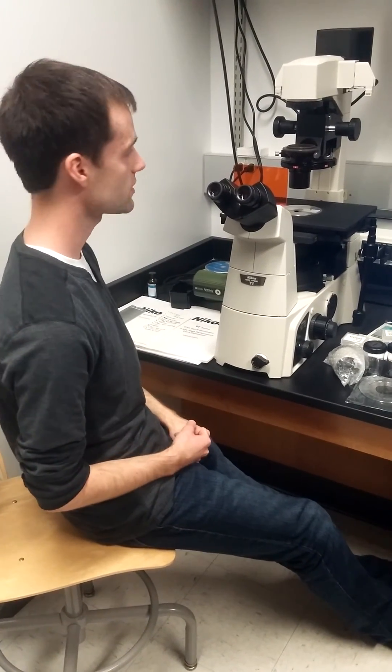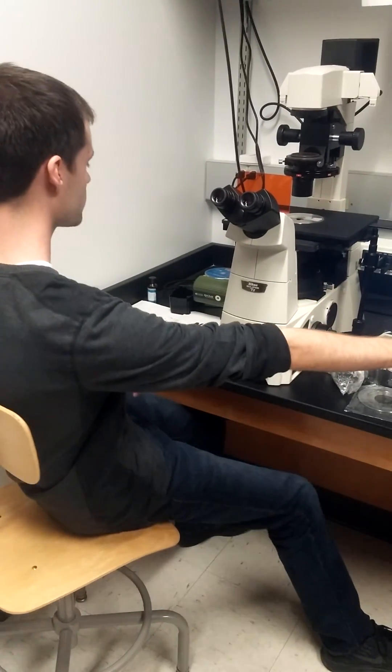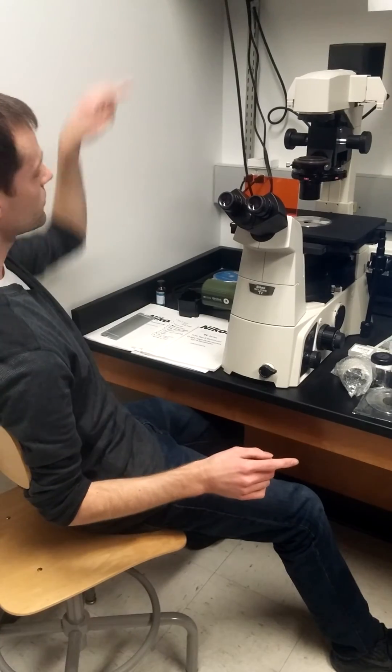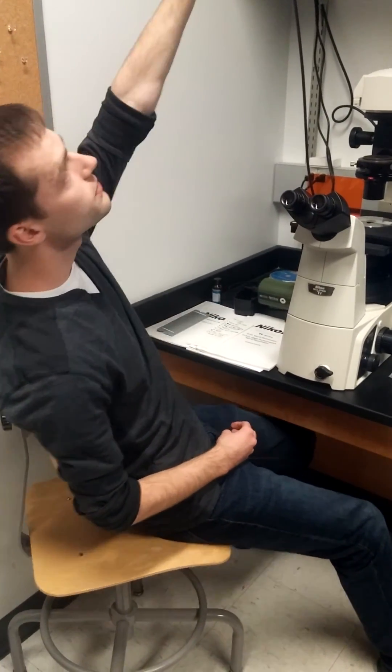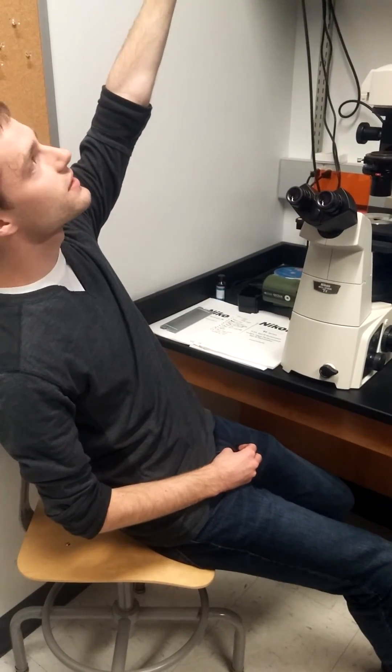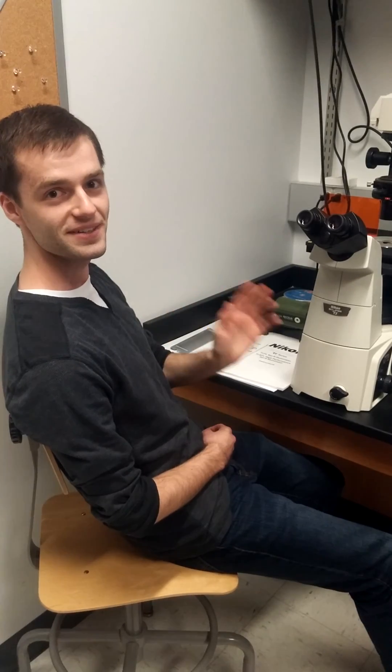Anyway, I think that's all for now. When you close up the microscope, close out of the software, run through these power buttons in reverse, and make sure to always put the dust cover back on the microscope. Thanks, and I'll see you in lab.